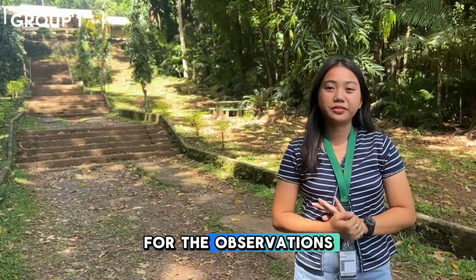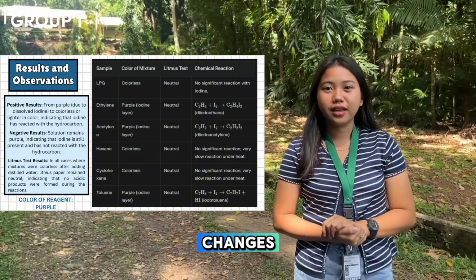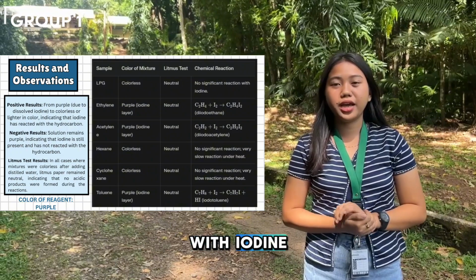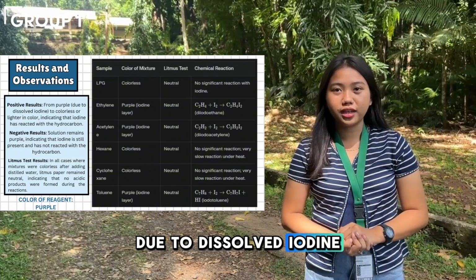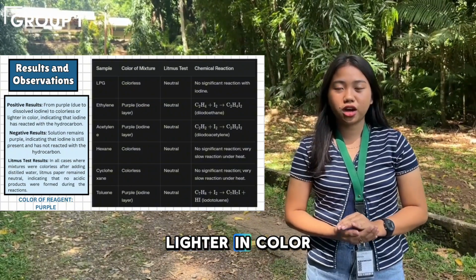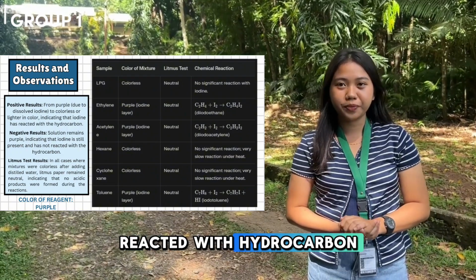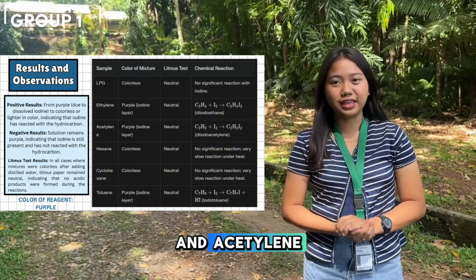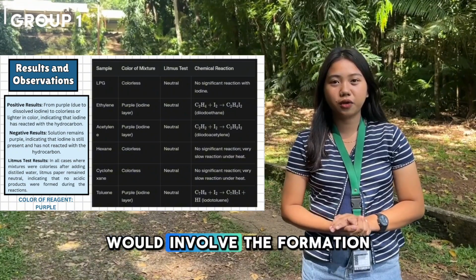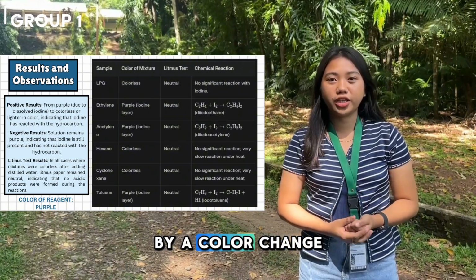Now for the observations, take note that the positive results have color changes. If a hydrocarbon reacts with iodine, the solution may change from purple, due to dissolved iodine, to colorless or lighter in color, indicating that iodine has reacted with the hydrocarbon. For alkenes like ethylene and acetylene, a positive result would involve the formation of iodo derivatives, which may be indicated by a color change.